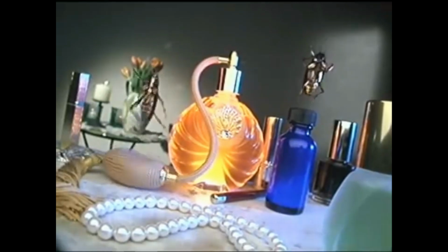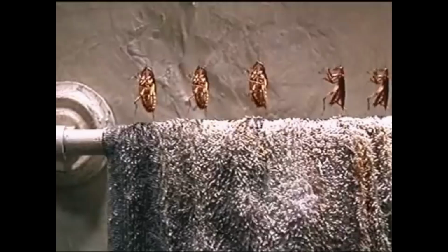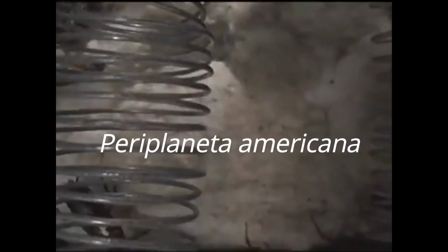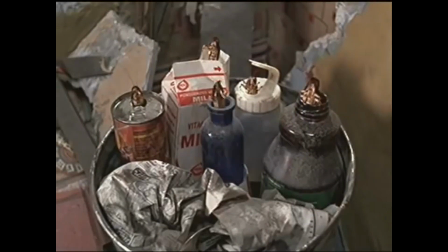The body of the cockroach is dorsoventrally flattened and is covered with a chitinous skeleton. The most common species of cockroach is the Periplaneta americana, which measures 3.4 to 5 centimeters in length.